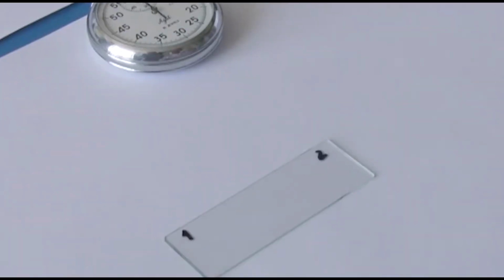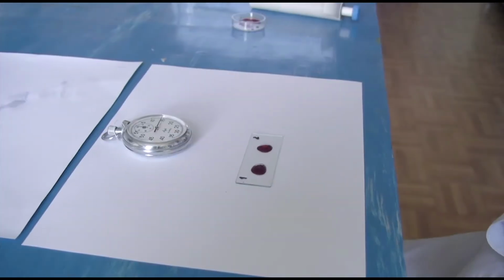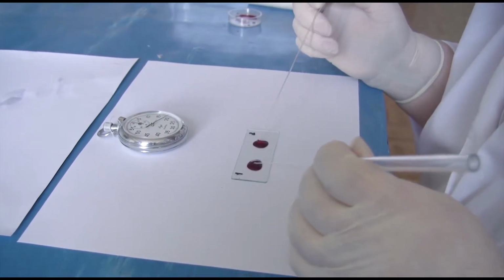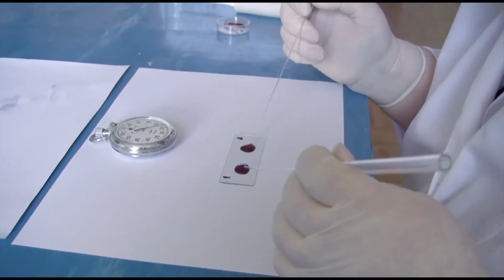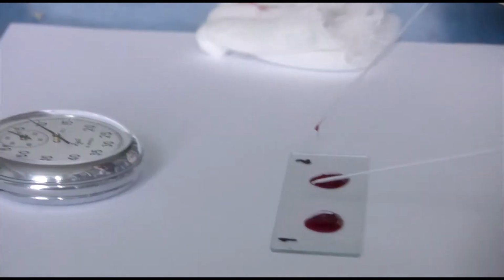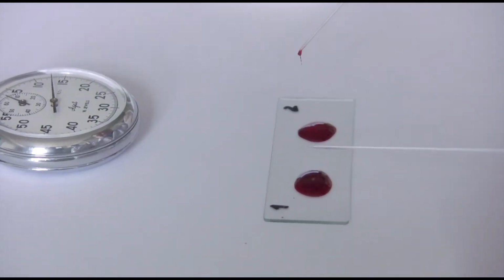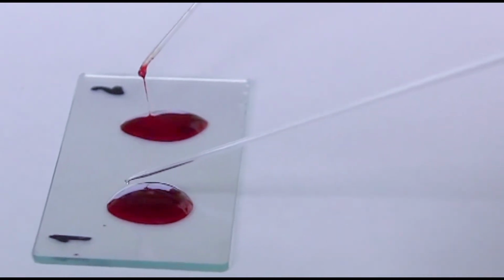Two drops of blood from each of the 2 comparative groups of mice were placed in a lab test glass. On this shot we can observe and evaluate the process of coagulation of the blood drops. Using 2 thin glass sticks, they checked the time for appearance of fibrin filaments. Here it is possible to see that such filaments appear on the right side, blood sample number 2. The blood sample number 1 on the left side instantly has shown a high liquefaction.